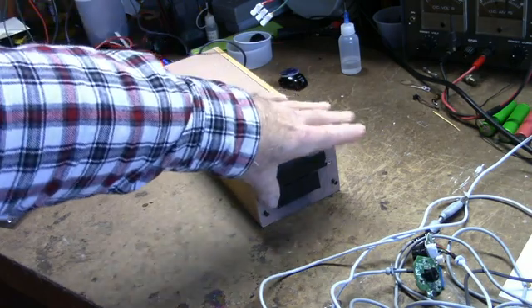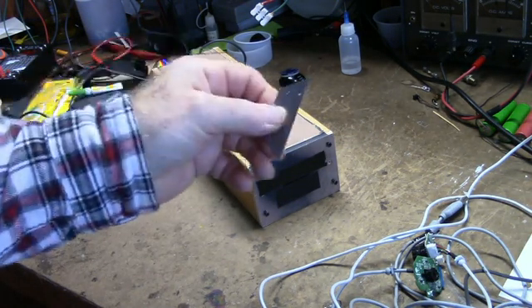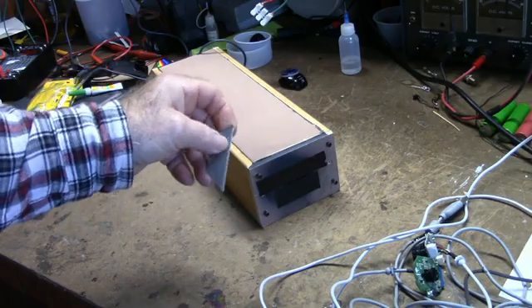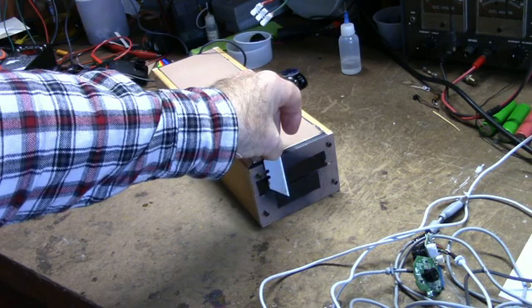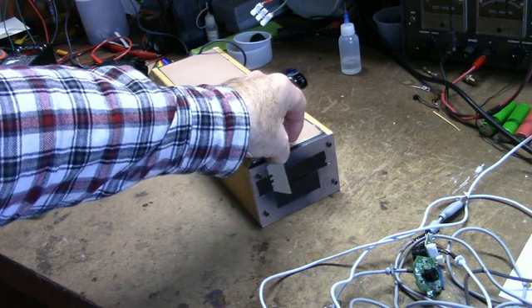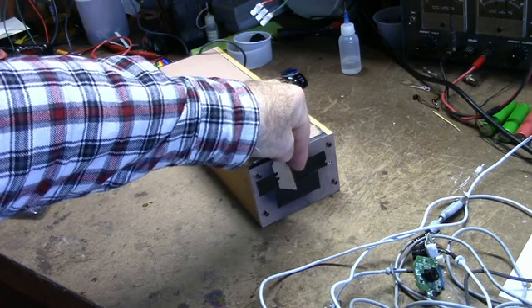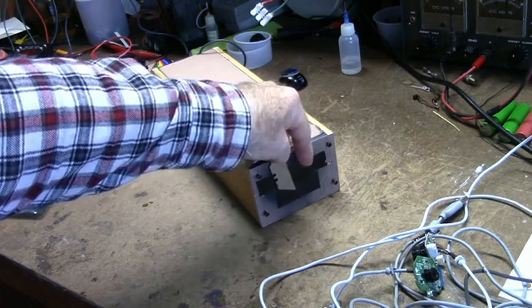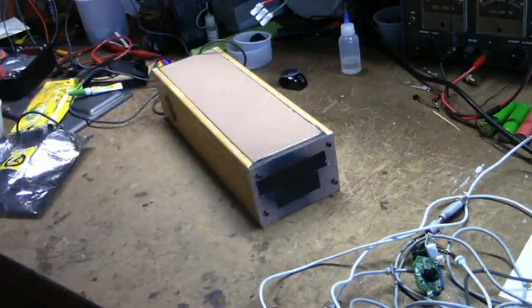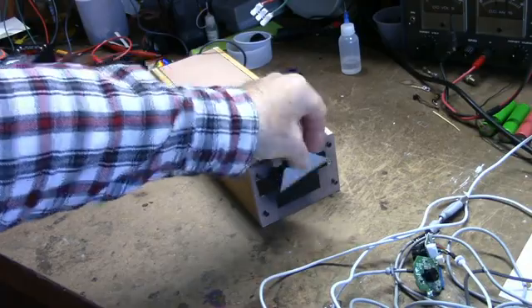One thing I have to do next, I'm going to take two utility razor blades, and these will be mounted here, and I'm going to build an assembly that I can move these back and forth. It'd be one opposing this one, and by moving them closer together or farther apart, I can vary the width of the slit, the opening. I should say it's this way. And then I'll spray paint it black.